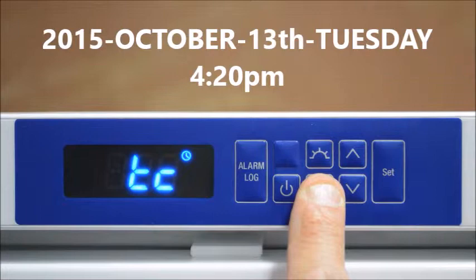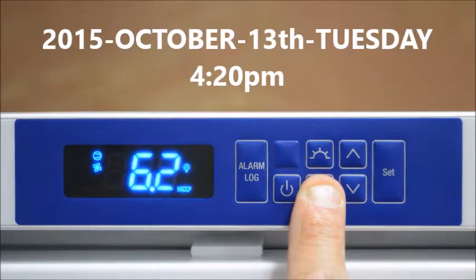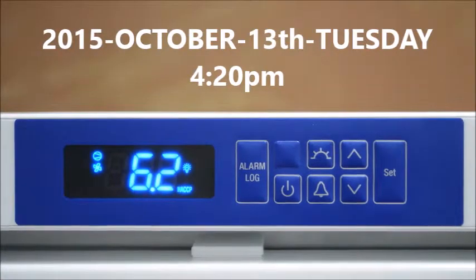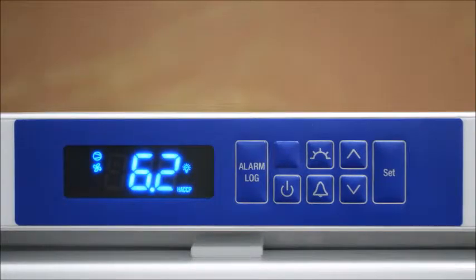We now have the year, the month, the date, the day, the hour and the minute set into the unit's memory.